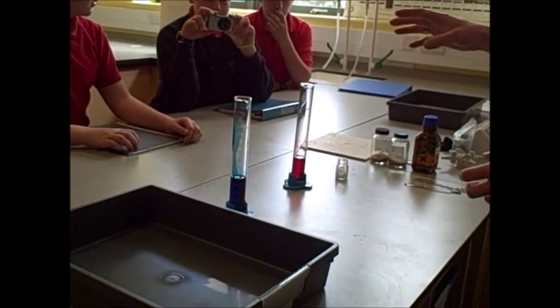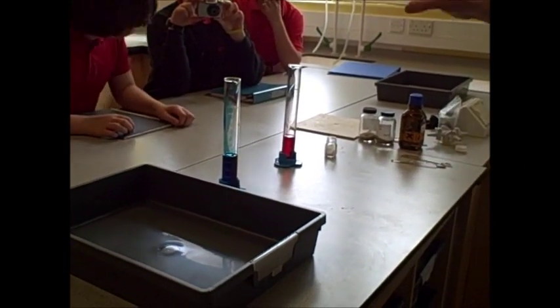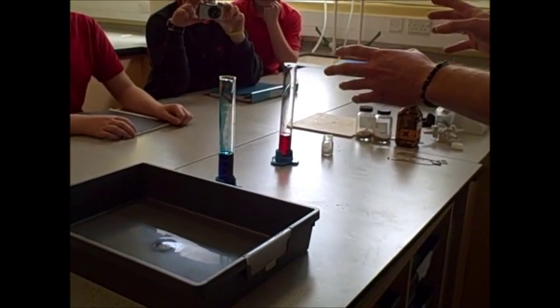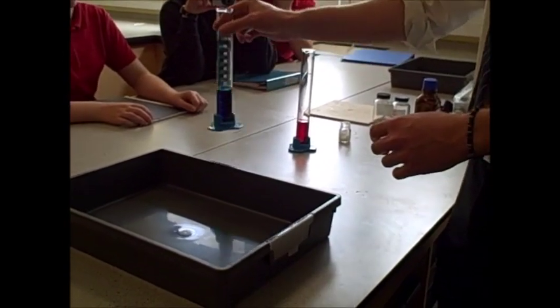Alright then, two different setups — hydrogen peroxide in each measuring cylinder. There is a subtle difference between them; I haven't told you what the difference is yet. Let's go with the blue one first.